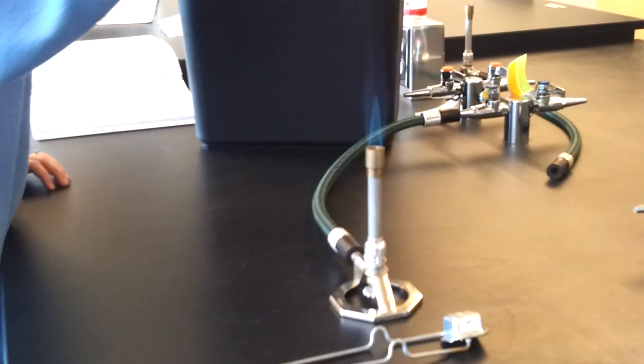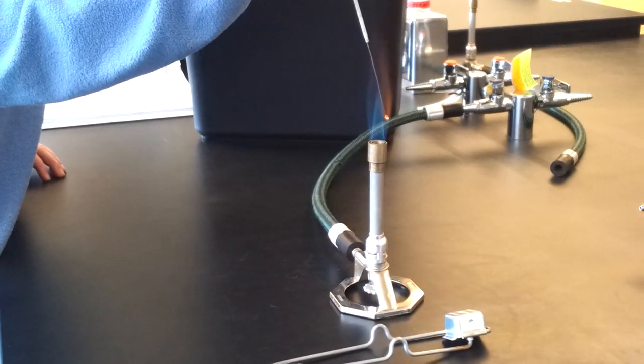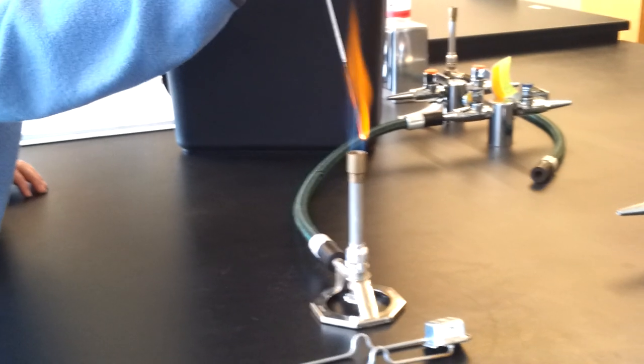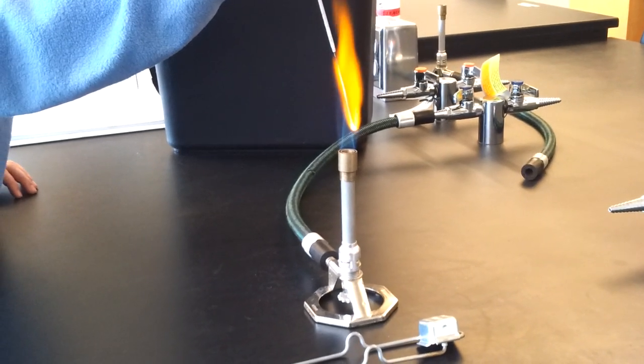Okay, I'll show you that one more time from a slightly different angle. Notice that the angle that I'm holding the inoculating loop at is about 1 o'clock.